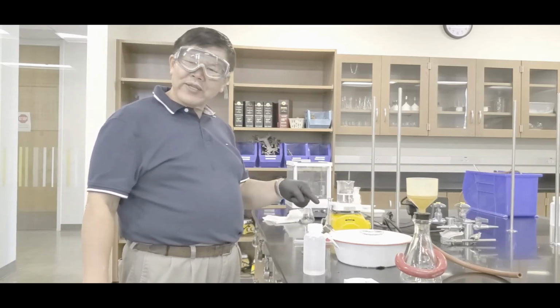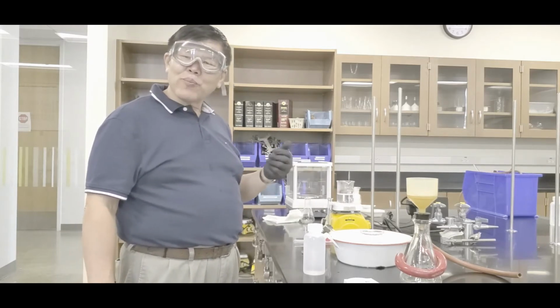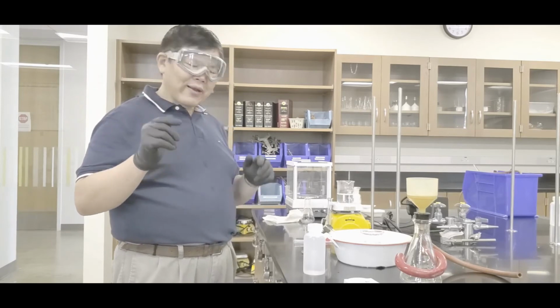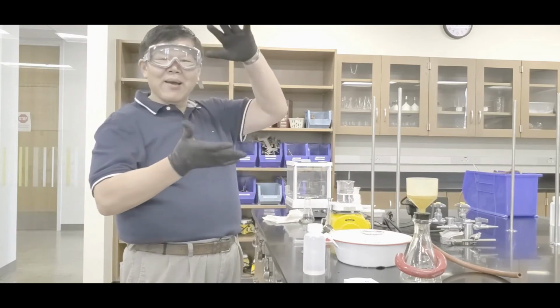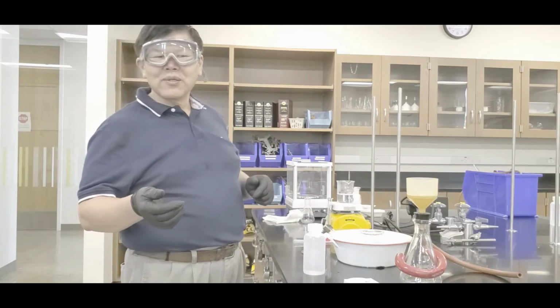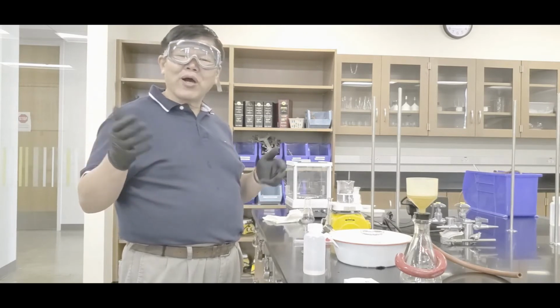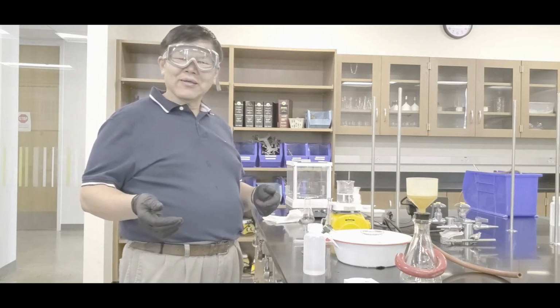So what I'm going to do is this. We're going to wait for the aspirin to precipitate out, to crystallize out. So basically what happens initially, you ever done a snow globe? Shake it like that, and there are little flecks coming out? That's what it should look like. And then afterward, once you've got a lot more, I typically wait about 15 minutes after the initial. Now, the longer the better, but you may not want to wait that long. So in that case, we'll wait about 10 to 15 minutes and watch for it to crystallize out. When that time comes, I'll come back. Okay.